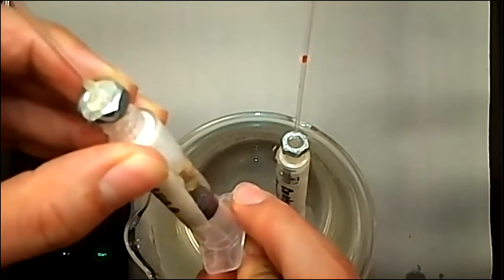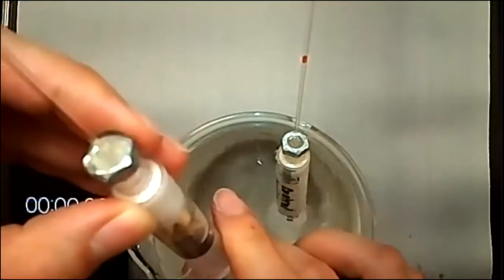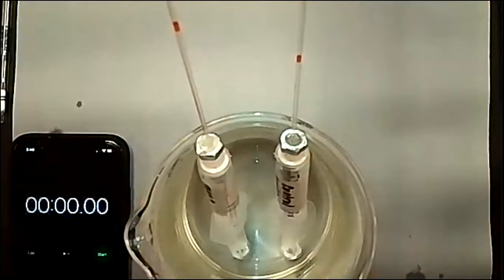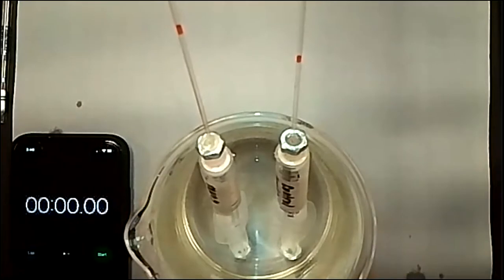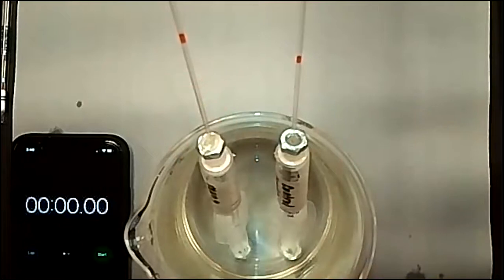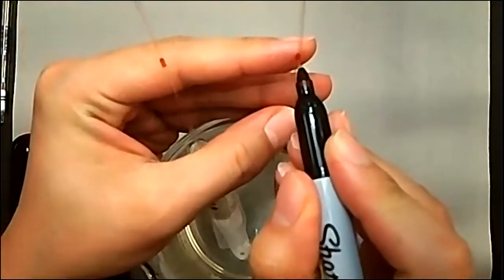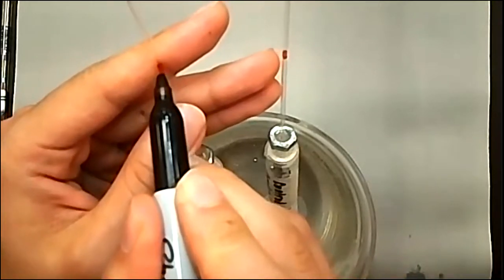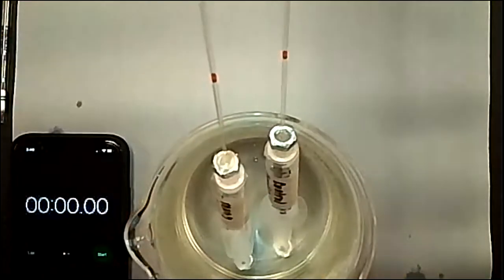So this is a pretty difficult lab to actually do by hand. So it's kind of nice that we're doing a demo version of it. And right now it's okay that they're at different heights, and that the amount of fluid in them is different, because we just want there to be fluid in there that is marking the location. So I'm going to mark it and start time now, and every 2 minutes I will mark it again at the base of the manometer plug to show where it has moved to. So let me go ahead and start time.